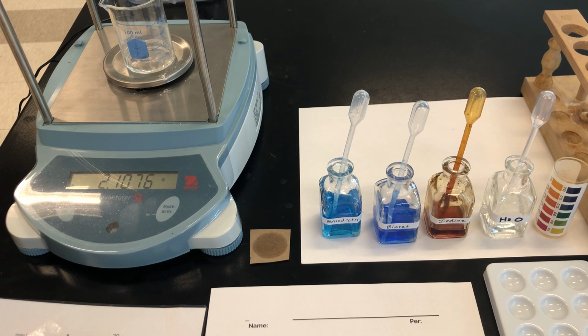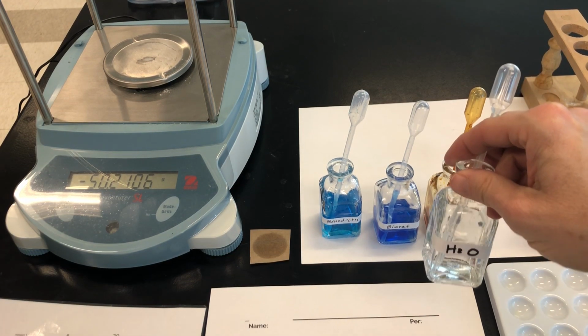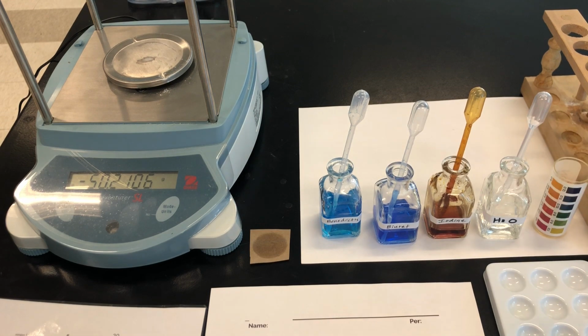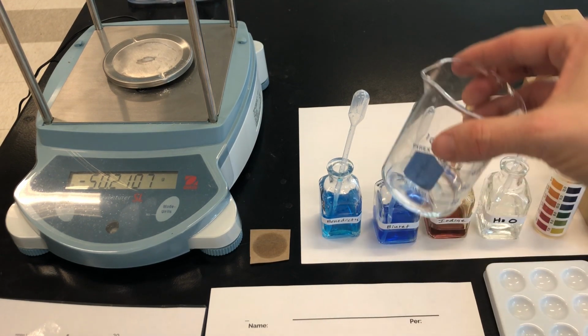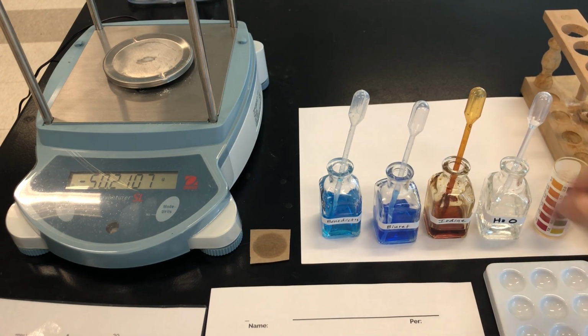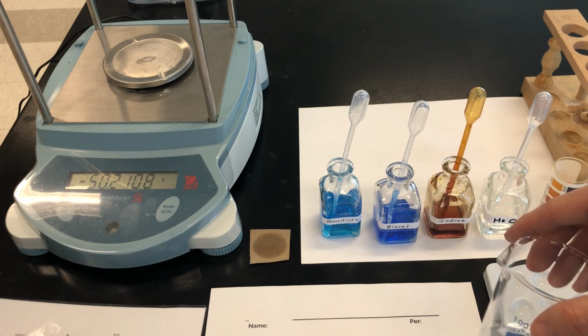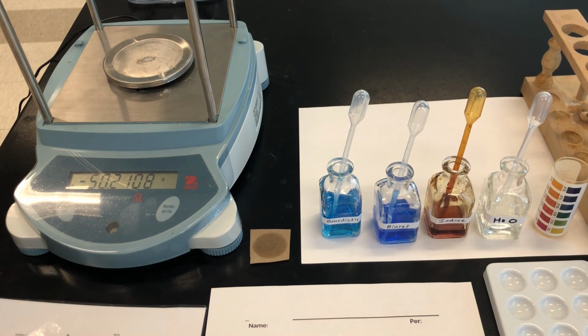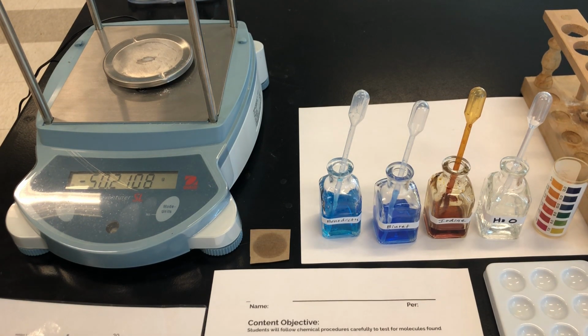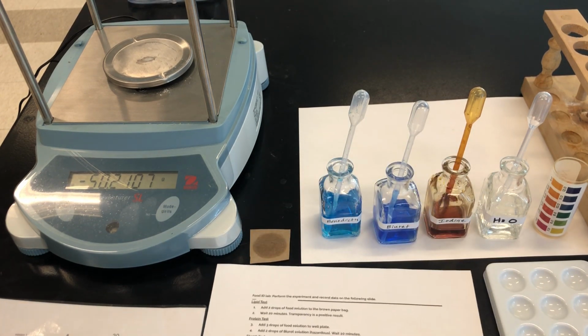If your substance is a powder, then after you add the 2 grams of powder, you're going to add water from this container until it's a liquid substance. We want these to be able to be dripped to use in some of the tests. So if you can, add water from the water bottle until the substance that you have is more liquefied. Some will require more water than others. Part of the reason that we do that also is so we can observe whether it's soluble, does it dissolve easily in water, and record that in the chart.